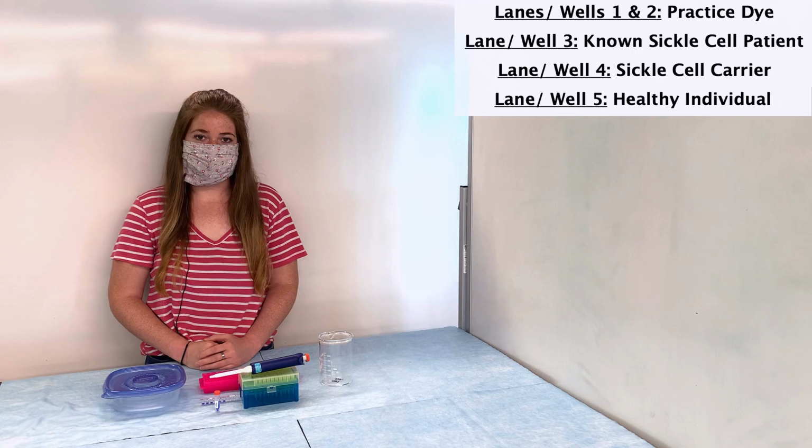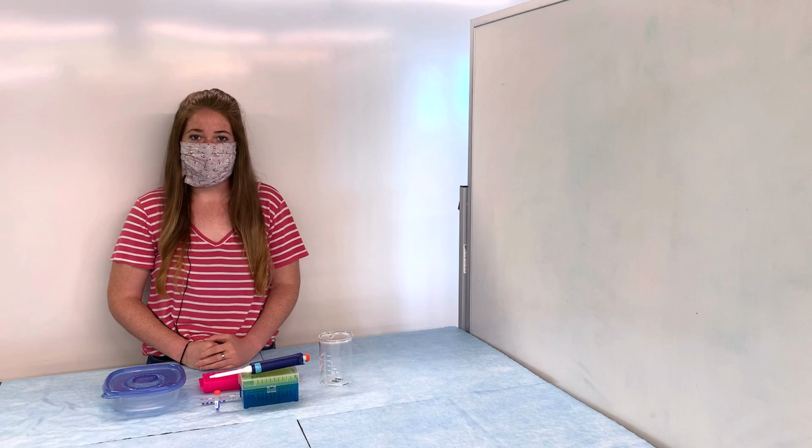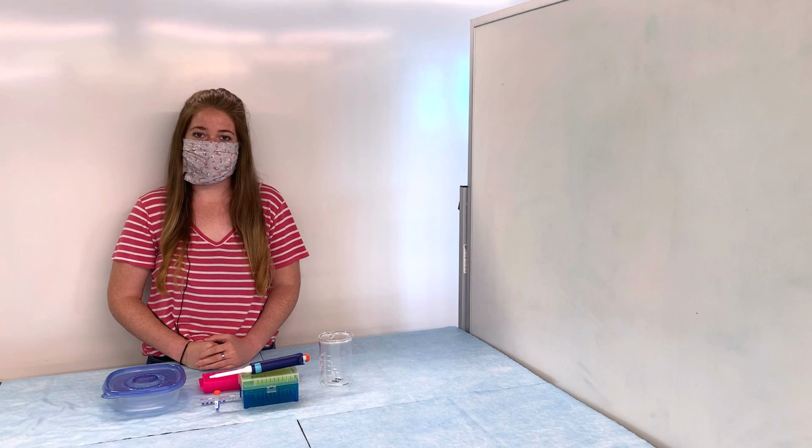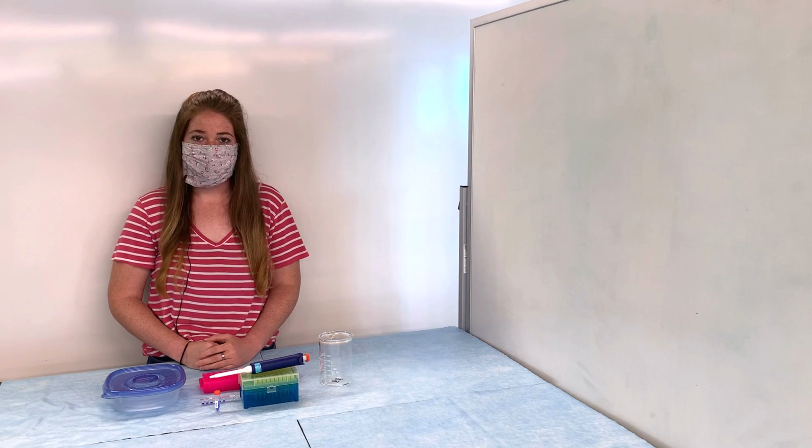And then finally, in the last 3 wells, which are lanes 6, 7, and 8, we'll have samples from the mother, child, and father, respectively. Remember, we don't know yet whether or not these individuals have or carry sickle cell anemia. So running their DNA through the gel will allow us to determine this. After the samples are loaded into the wells, I'll place the gel into the gel box where the electrical current will separate the various fragments. Once that's completed, I will actually need to apply a dye or a stain so we can see the banding pattern more easily. Once those 2 steps are completed, we'll go over the results.